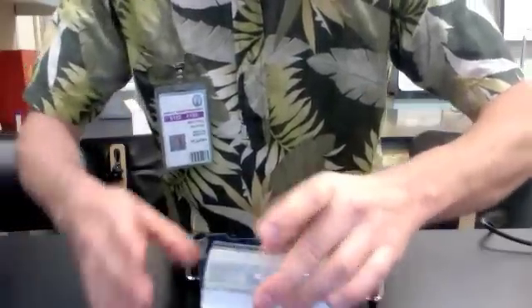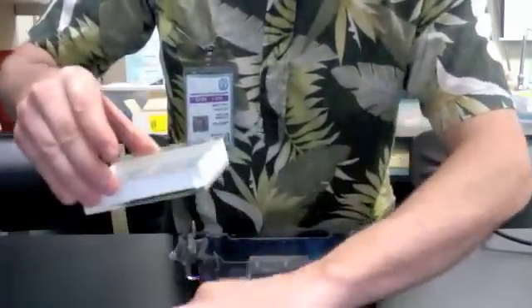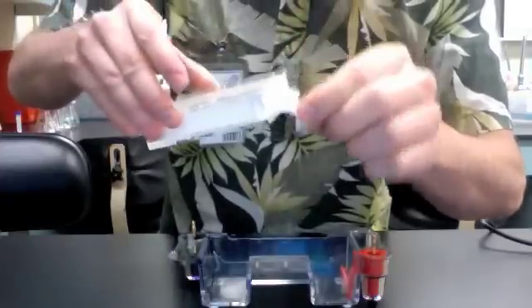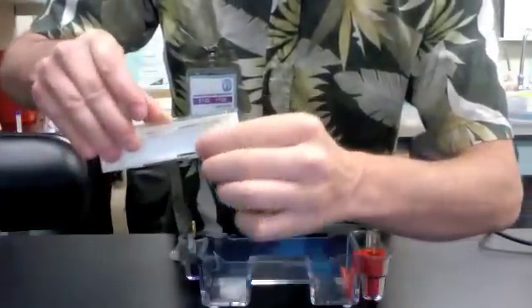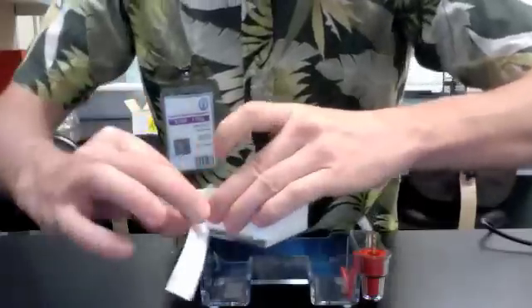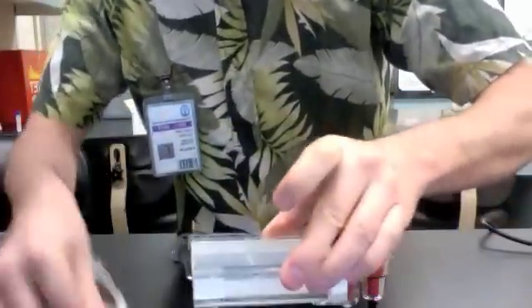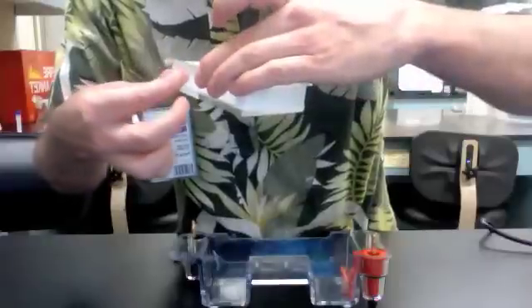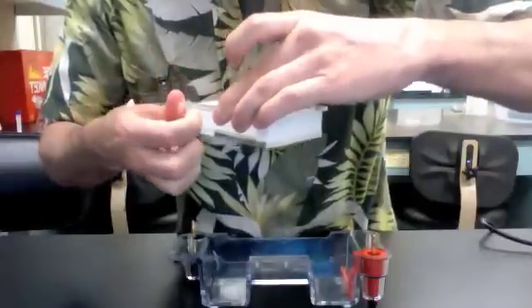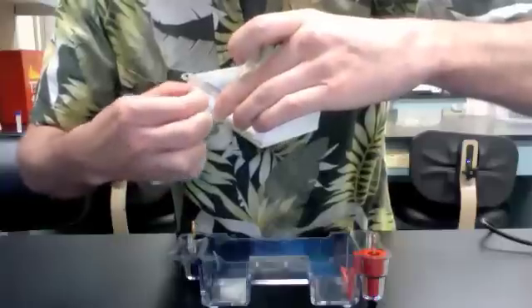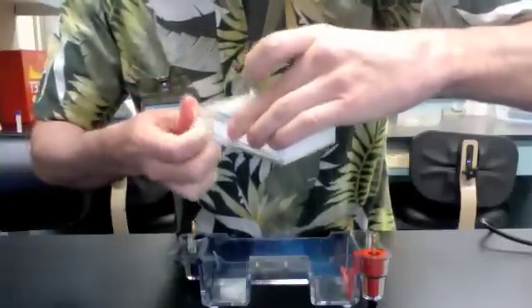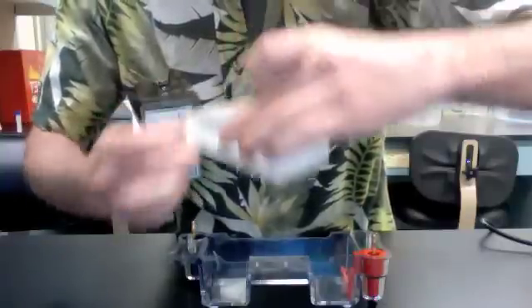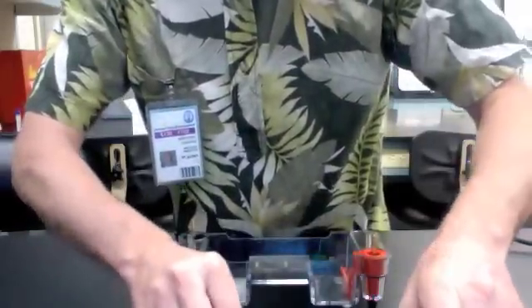Remove all these pieces of tape. Set that down, there we go.